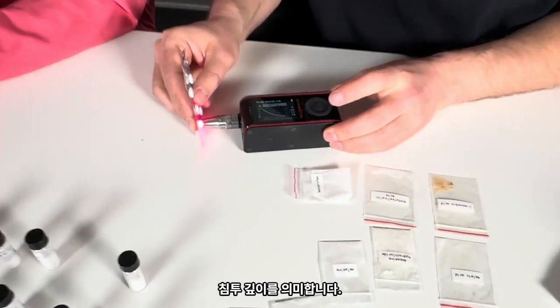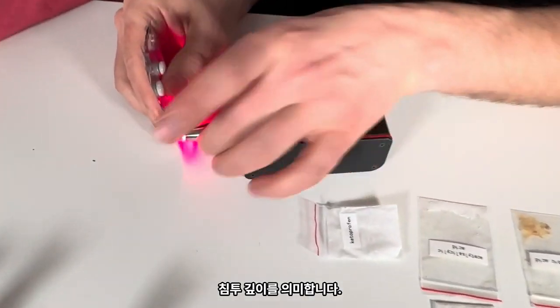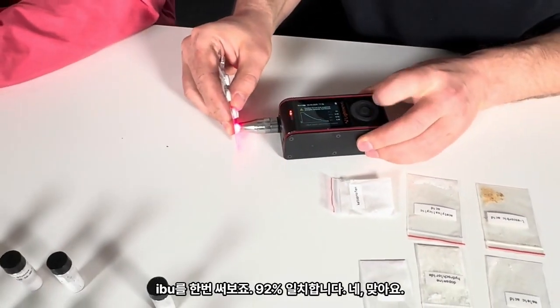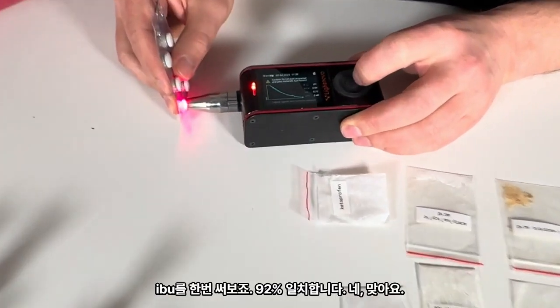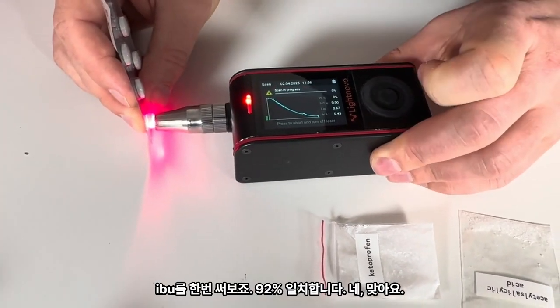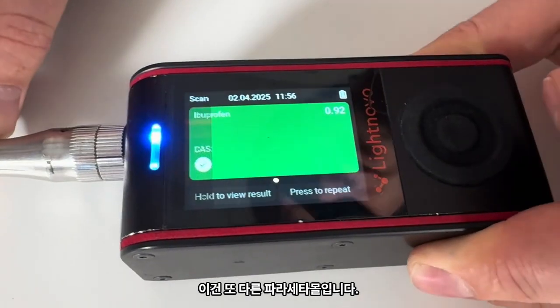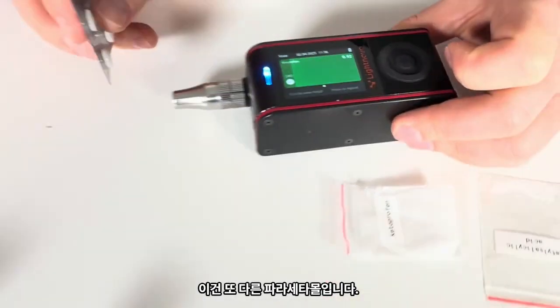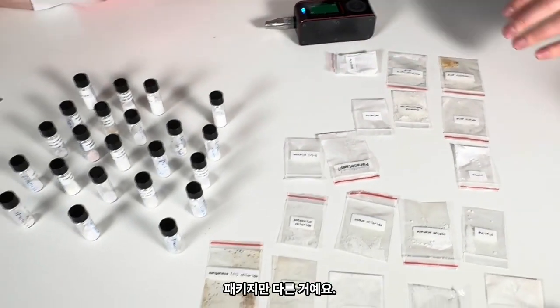I mean, the penetration depth only. That's it. Deeper or? Let's try. Ibumetin 92% correlation. Ibuprofen, yes. Ibuprofen, yeah. So this is correct.